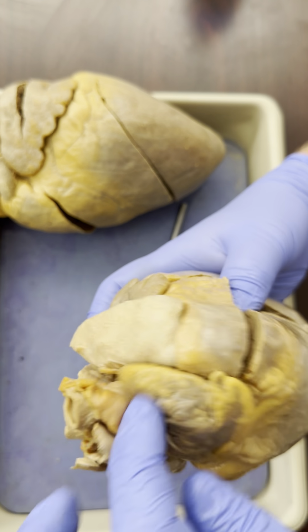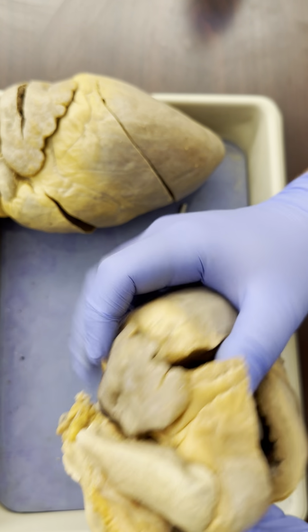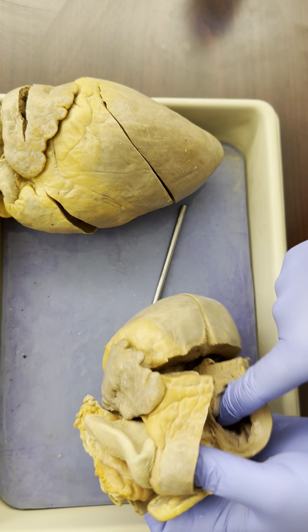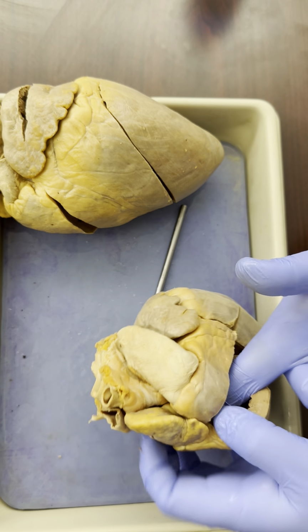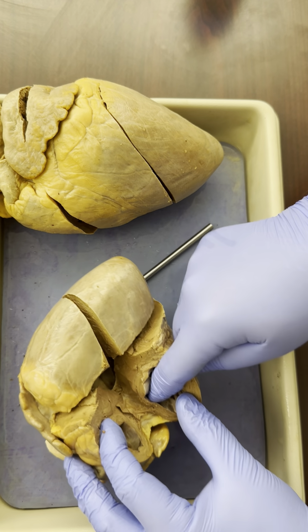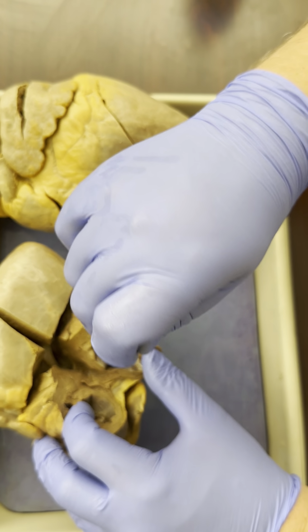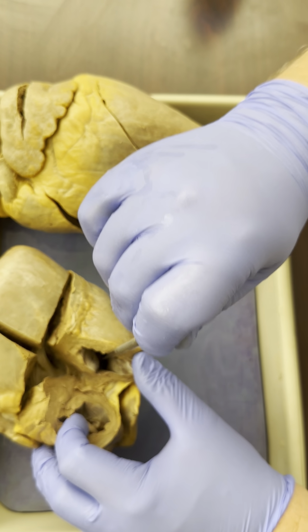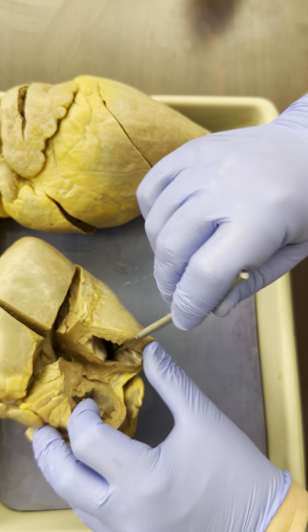Now, between the right atrium and the right ventricle. So if I were to go through the right ventricle into the right atrium, where my finger is right now, and pull it back, a little hard to see with the camera, but if we look up inside, this membrane right here, the membrane in between the right atrium and the right ventricle is the tricuspid valve, or the right AV valve.